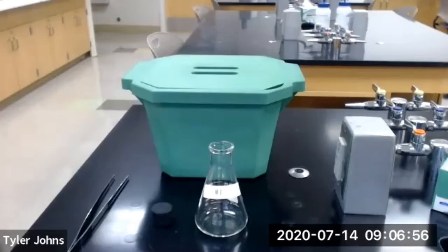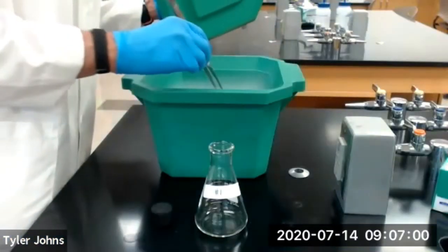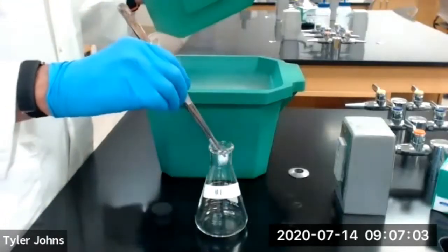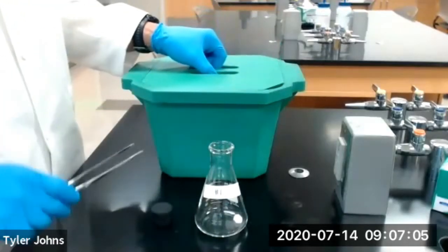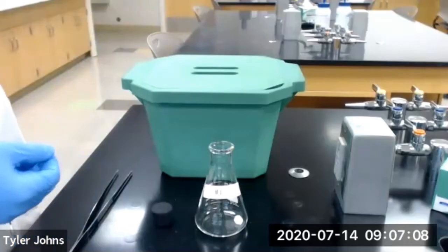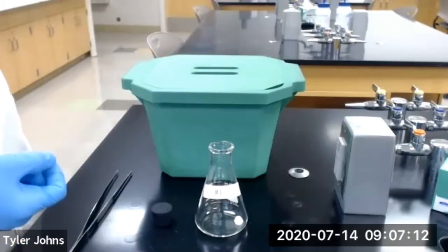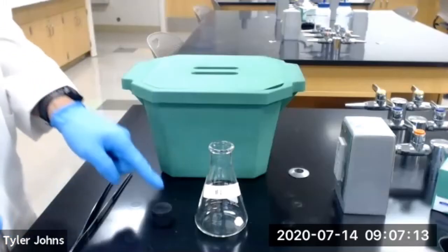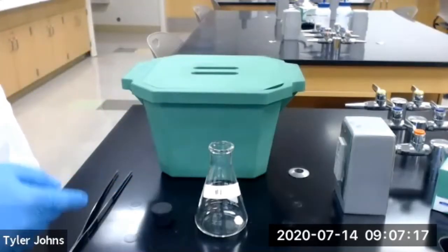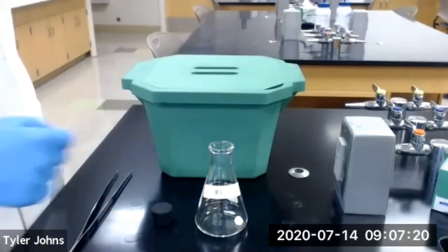We now need to obtain a small piece of dry ice, about the size of a marble, and place it in our Erlenmeyer flask. We'll allow the dry ice to completely sublime, and once it has completely sublimed, we will stopper our flask and determine the mass of the flask, the stopper, and the carbon dioxide gas inside the flask.